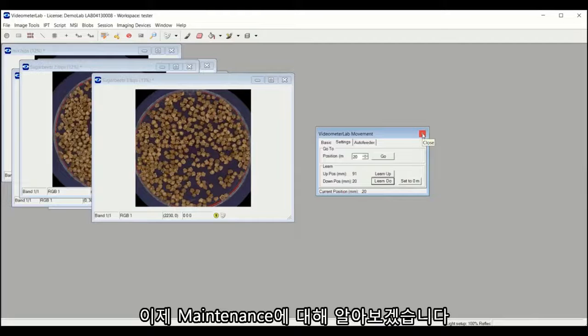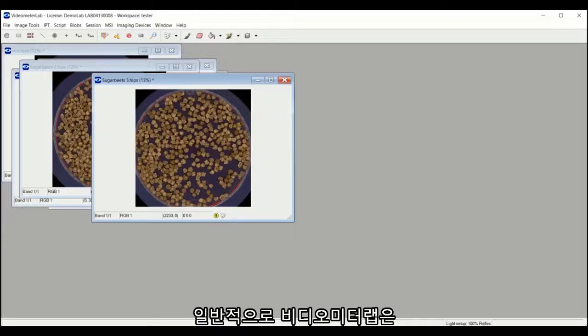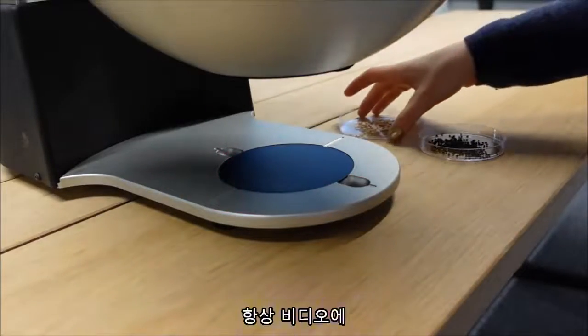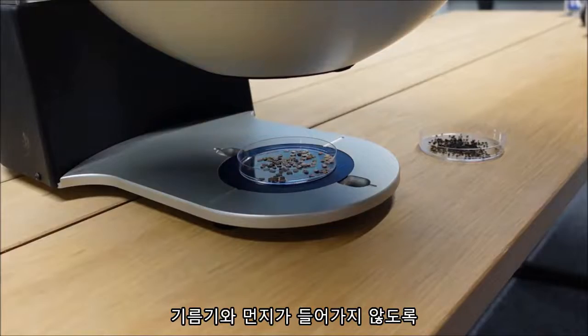Now we will have a look at maintenance. In general, the Videometer Lab device is really easy to maintain and requires very little service. There are just some few general rules and guidelines. It is very important to keep the inside of the Videometer Lab clean. This means that at all times one should be aware not to get grease and dirt into the Videometer Lab dome.